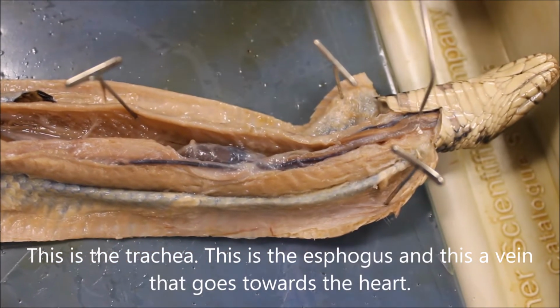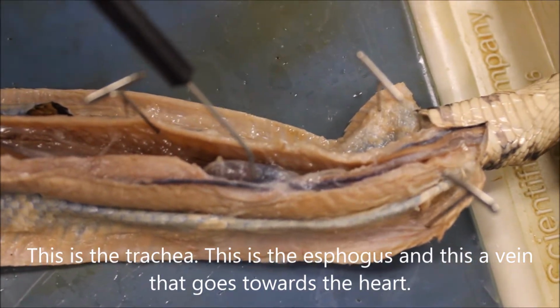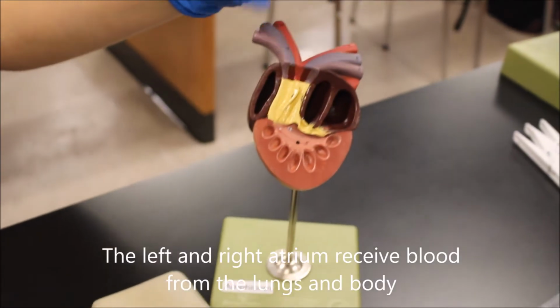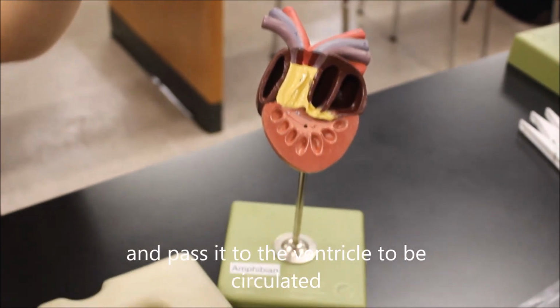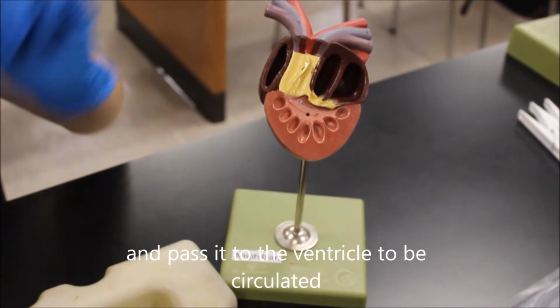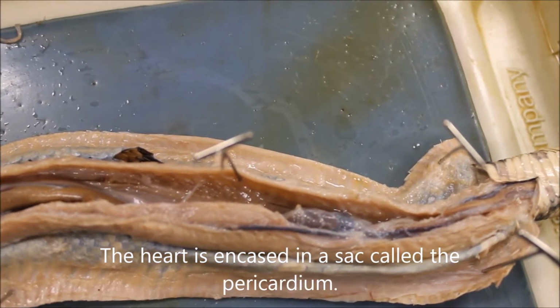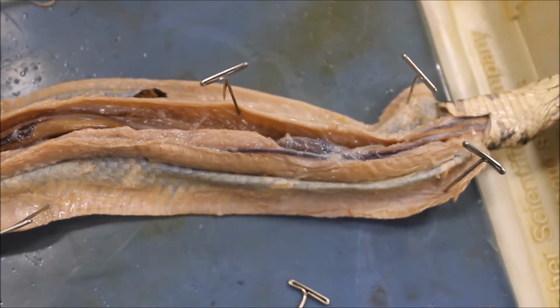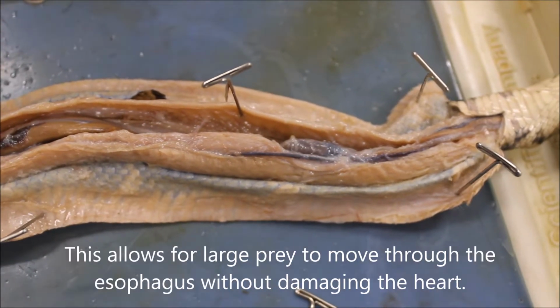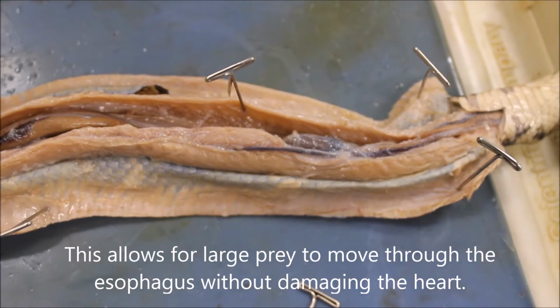This is the trachea, this is the esophagus, and this is a vein that goes towards the heart. The left and right atria receive blood from the lungs and body and pass it to the ventricle to be circulated. The heart is encased in a sac called the pericardium. It is located at the branching of the bronchi, and the heart is able to move around because of the lack of diaphragm. This allows for large prey to move through the esophagus without damaging the heart.